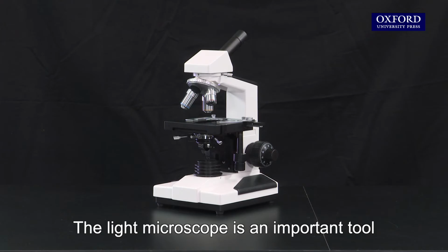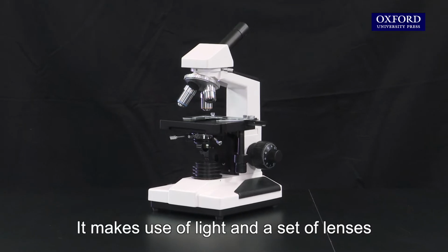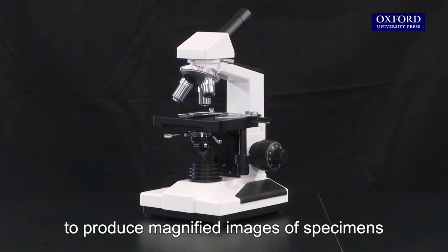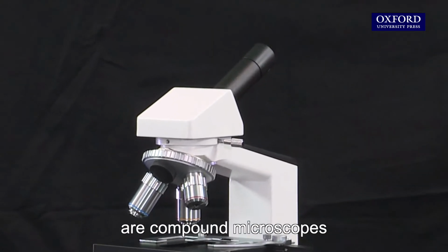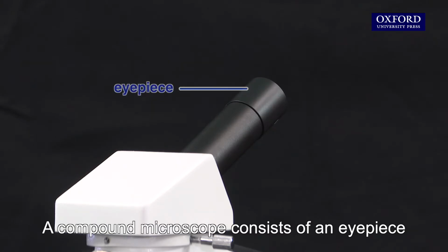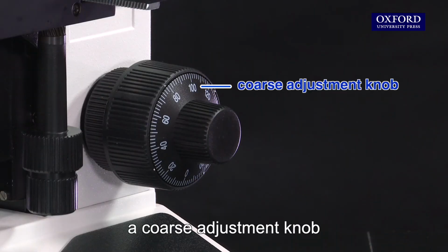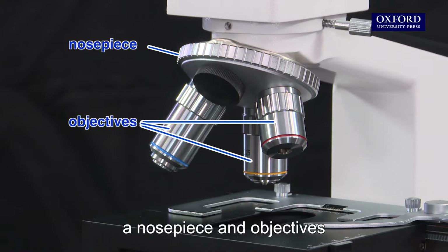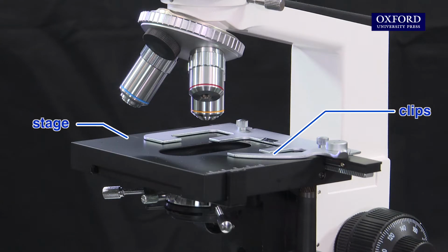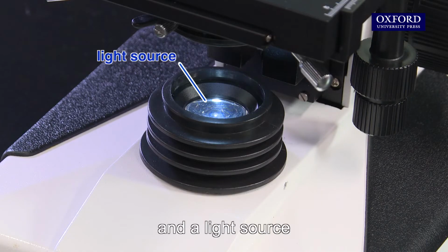The light microscope is an important tool in biological studies. It makes use of light and a set of lenses to produce magnified images of specimens. The light microscopes we use in the laboratory are compound microscopes. A compound microscope consists of an eyepiece, a body tube, a coarse adjustment knob, a fine adjustment knob, a nosepiece and objectives, a stage and clips, a condenser, a diaphragm, and a light source.